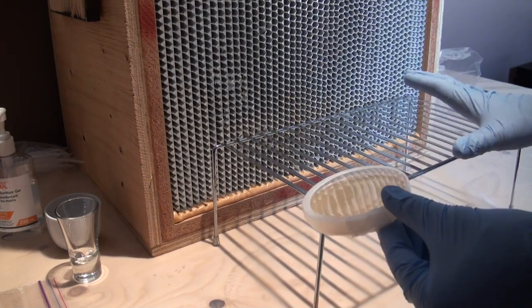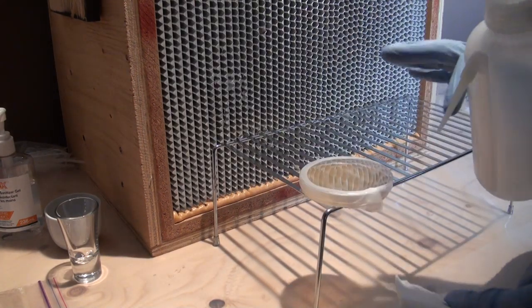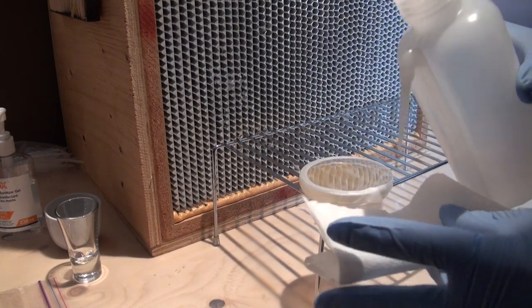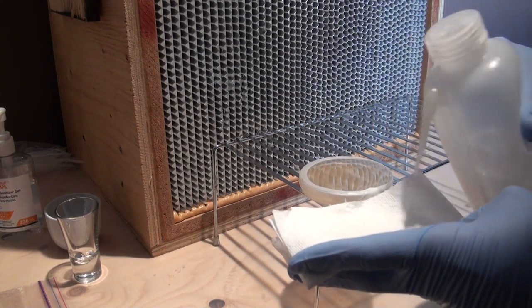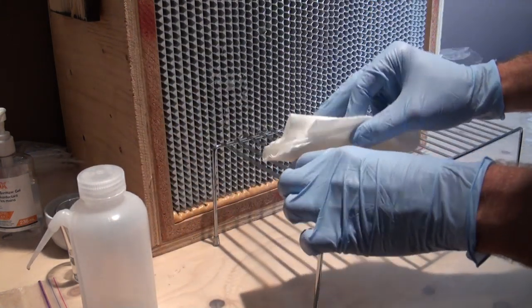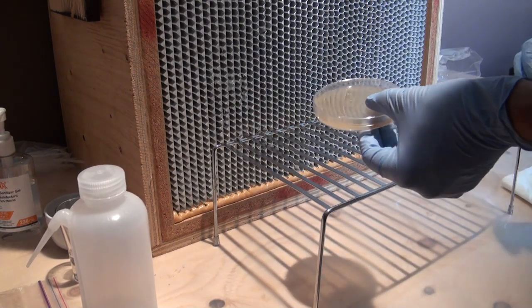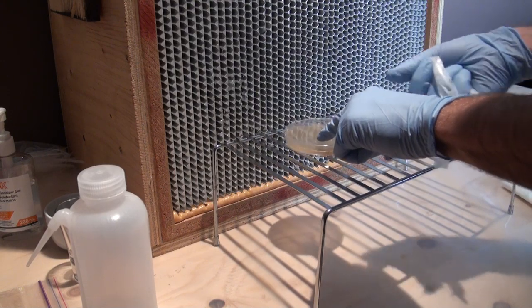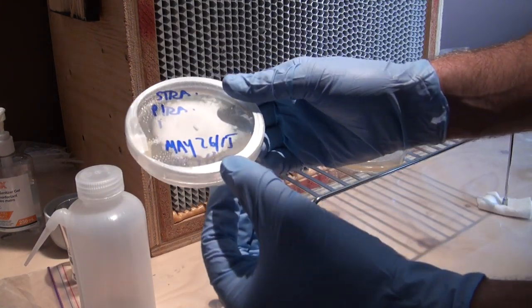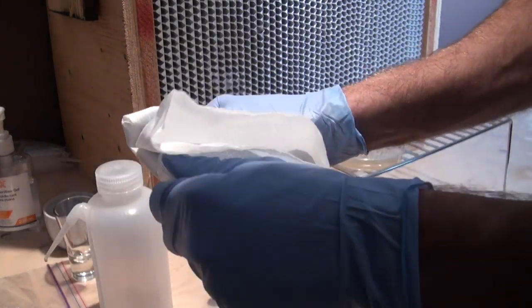The first step is to set your plates in front of your hood. Although these plates should be pretty clean, I still like to rub them down with alcohol. I've got my original culture here and I'm going to wipe that down with alcohol too.